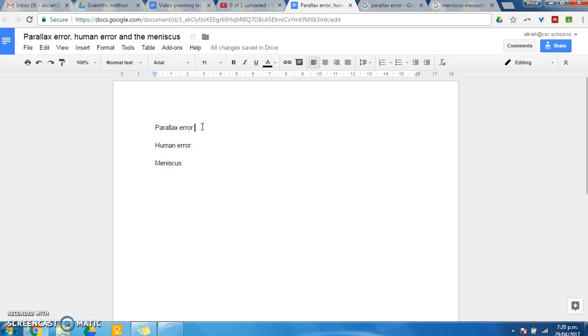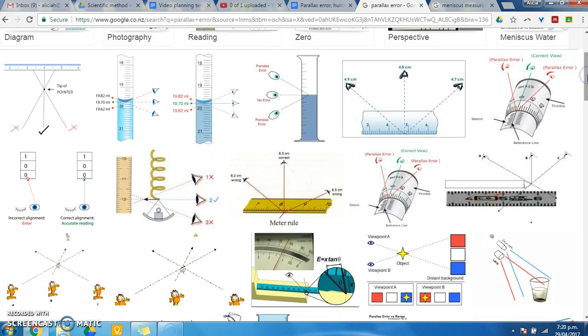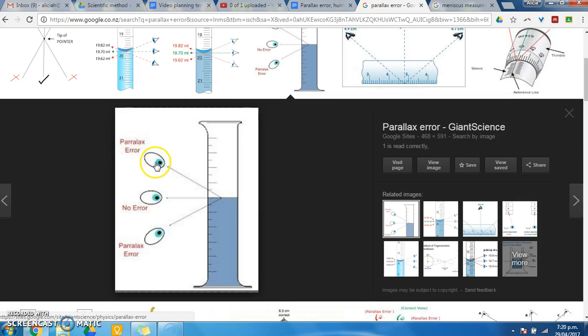So we'll start with parallax error. If you Google parallax error and have a look at the images, you will find a whole bunch of different stuff on parallax error and what it looks like. If you are measuring something, for example looking at a liquid in a measuring cylinder, and you look at that liquid from above, standing at full height looking at the level, then the level of the liquid is going to look lower than if you look at it from below. If you crouched down and looked up at the level of the liquid, then you would see the level as being higher than if you were standing at full height.